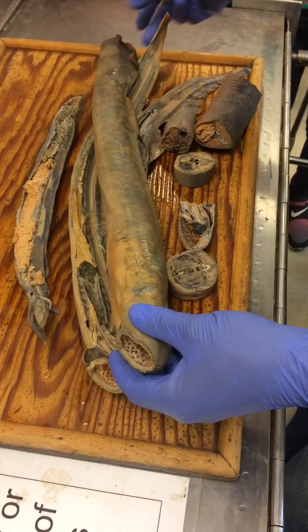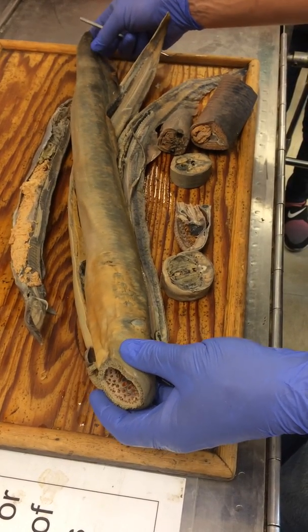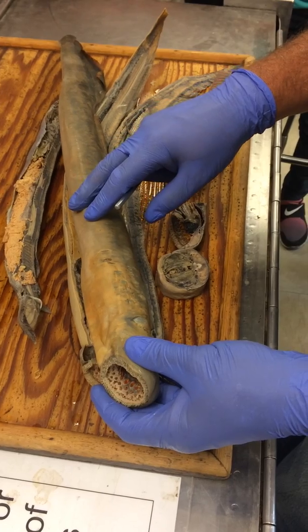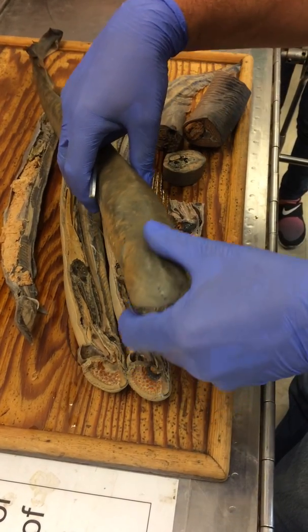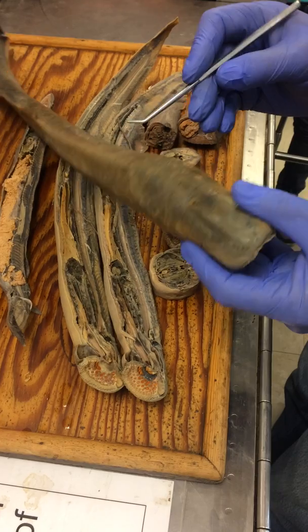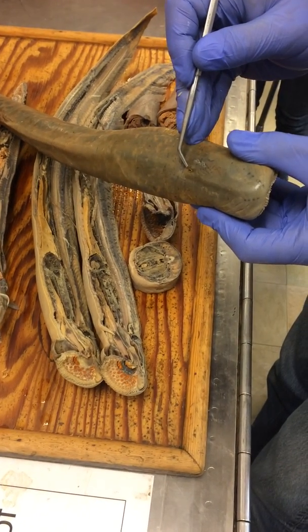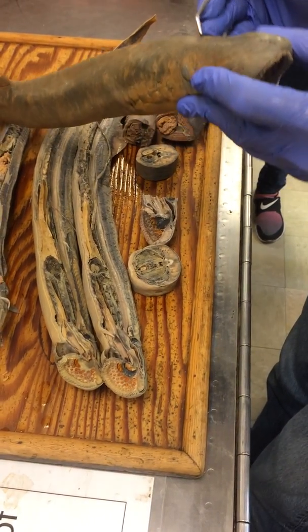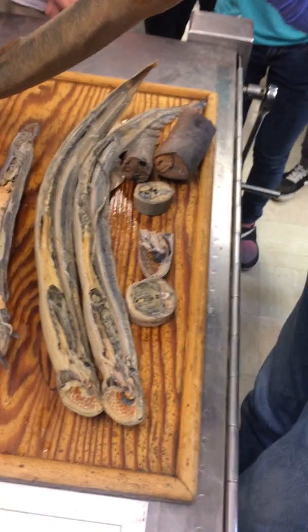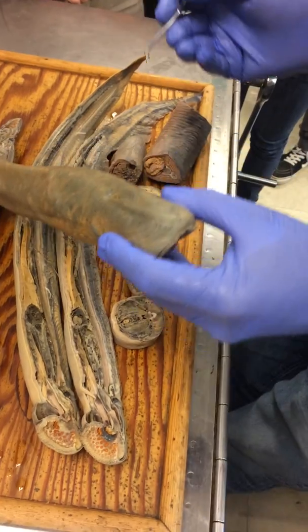Dorsal fins, caudal fin — I think none of this is really too challenging. You can see the nostril. It's nice on the intact ones to be able to see the median nostril on the top of the head. And then what's that light area right behind the nostril? The pineal eye — exactly — which is a light-sensing organ.